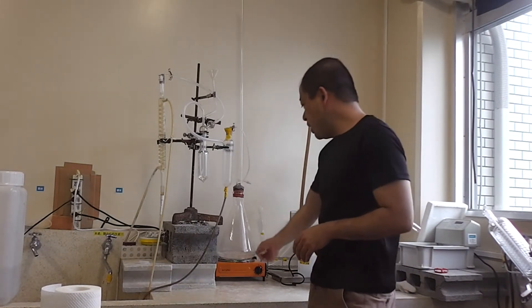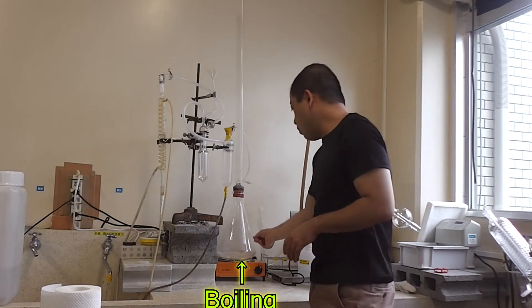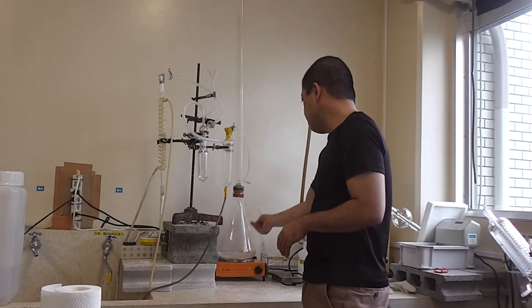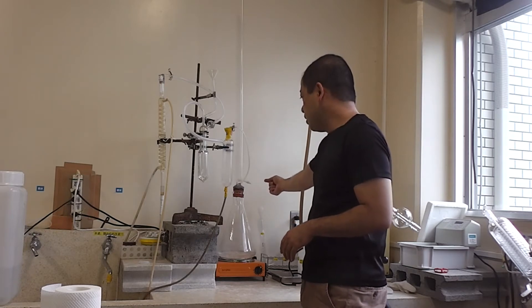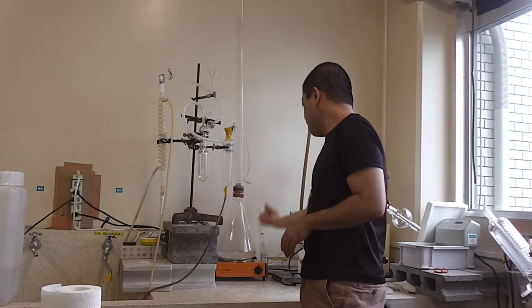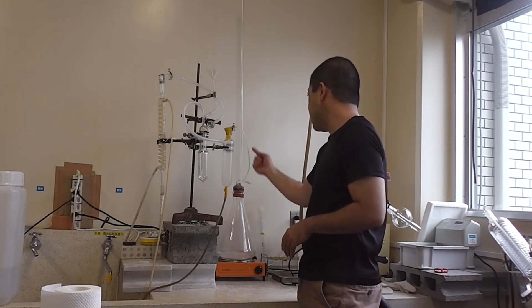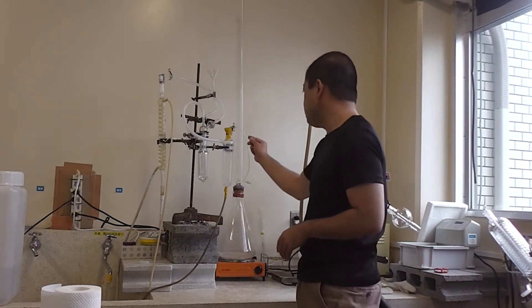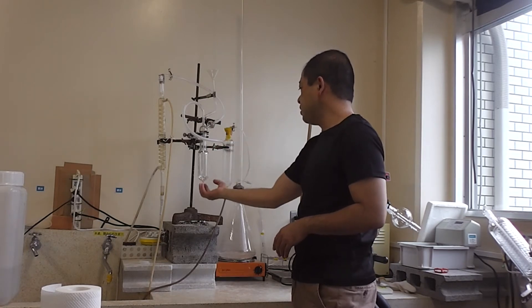Now we are heating the distilled water in the flask. By heating, we can put pressure inside. And so the steam, the vapor should go outside because now this one is open. But if you try to close here, of course the flow of the steam should go to another way, meaning this way. So this is just a pipeline. So the steam should be moved like this and get together here.